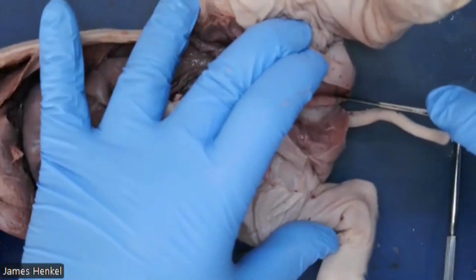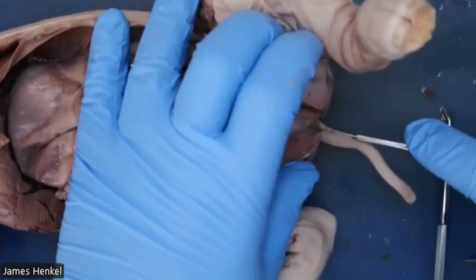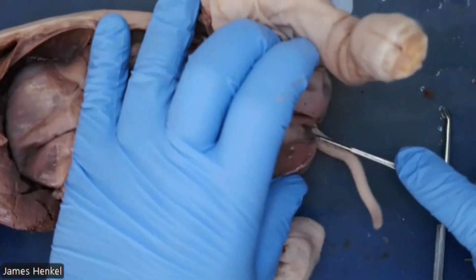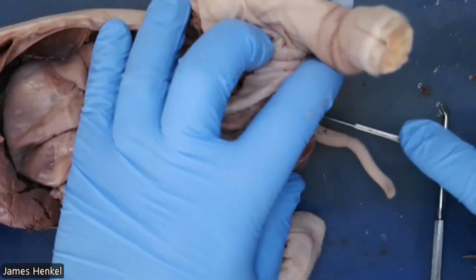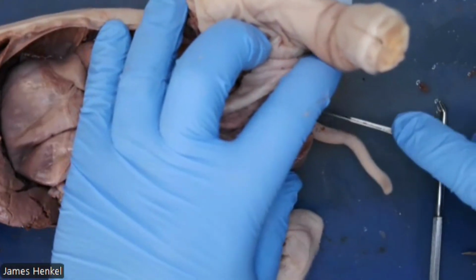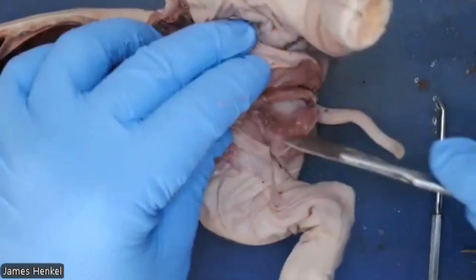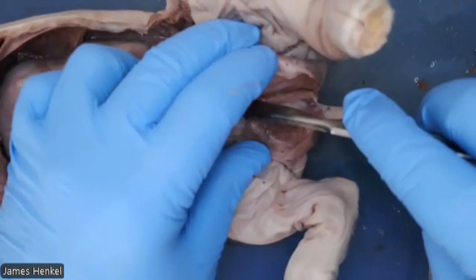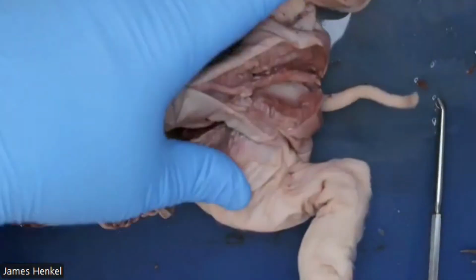And I am then seeing these two pale sacs there that are the testicles in their scrotal membranes. Sorry about putting my fingers in the way, but I had to get there. Okay, so you can see the penis there and then those pale sacs on either side.